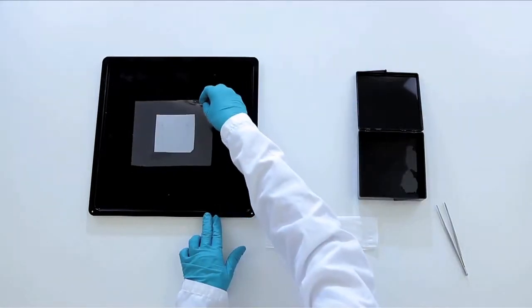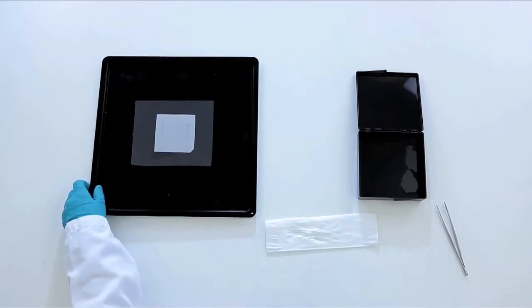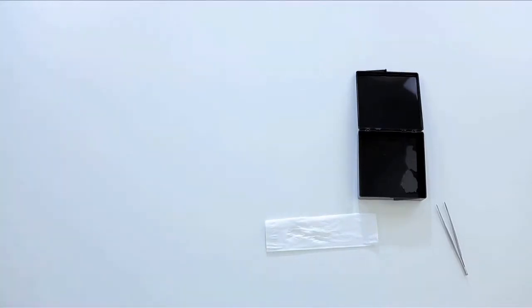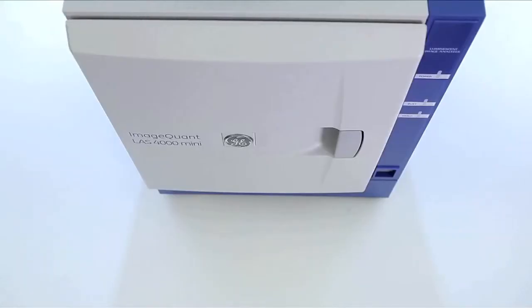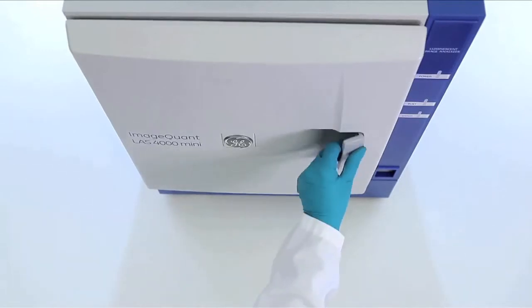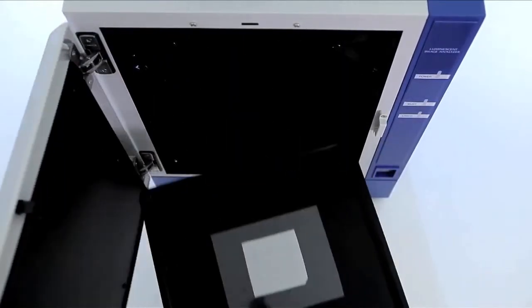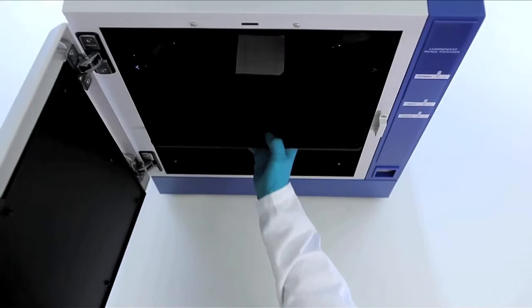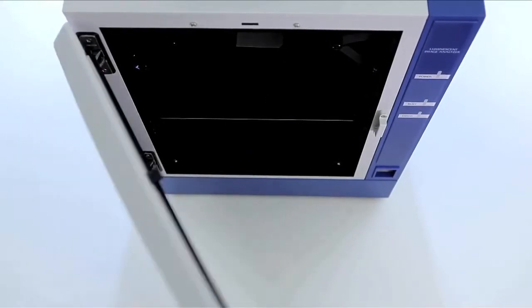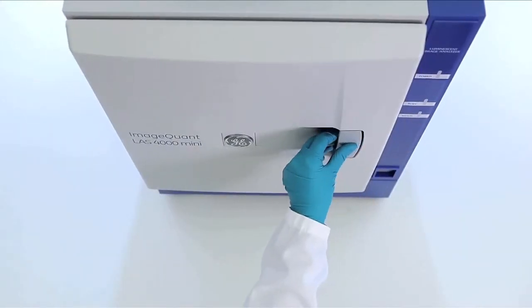X-ray film can be used, but a CCD camera is a better choice. There is no time pressure. The reaction is instant and the signal will last for hours. Place the membrane into the LAS-4000 or 4000 mini CCD imager. The stable signals let you repeat exposures to achieve the best sensitivity.